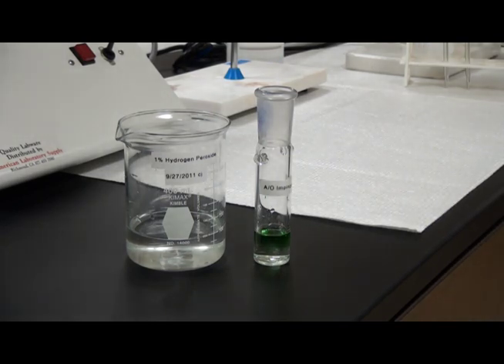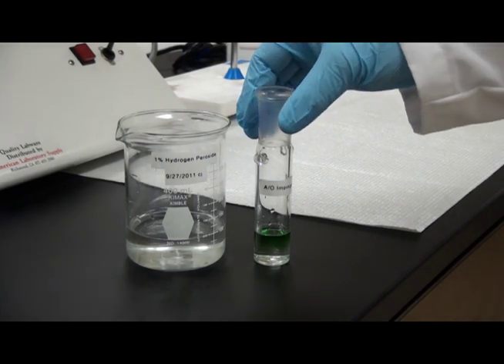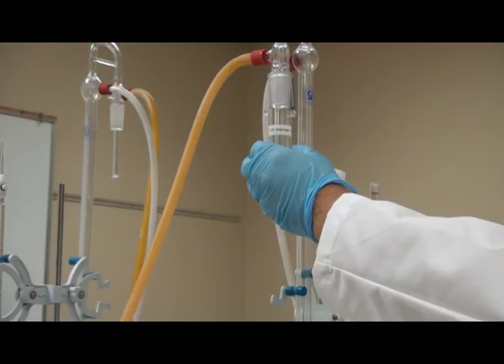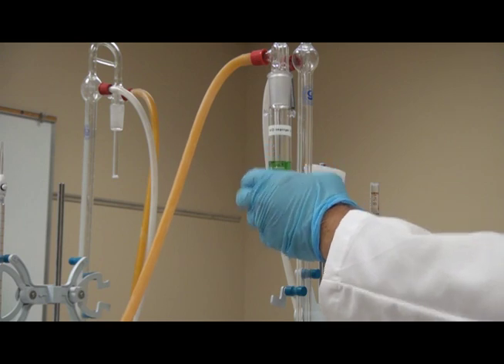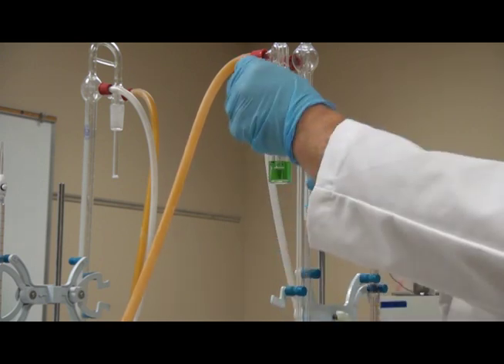The liquid should change to a gray-green color. Secure the impinger tube onto the apparatus with the impinger tube fully seated and the spring holders attached to the glass ears.